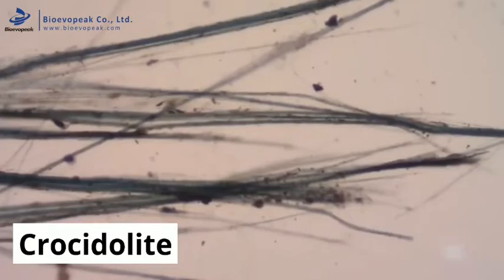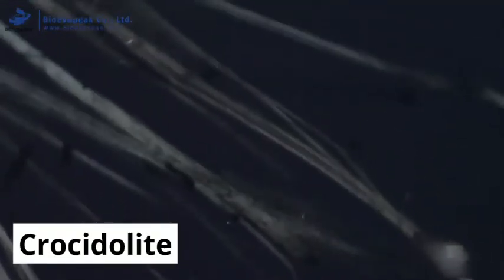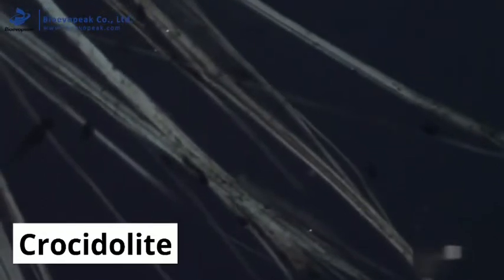Next you have the birefringence and extinction testing. This must show the fibre appear and disappear as we rotate it under a setting referred to as crossed polars. This confirms we have a mineral under the microscope.